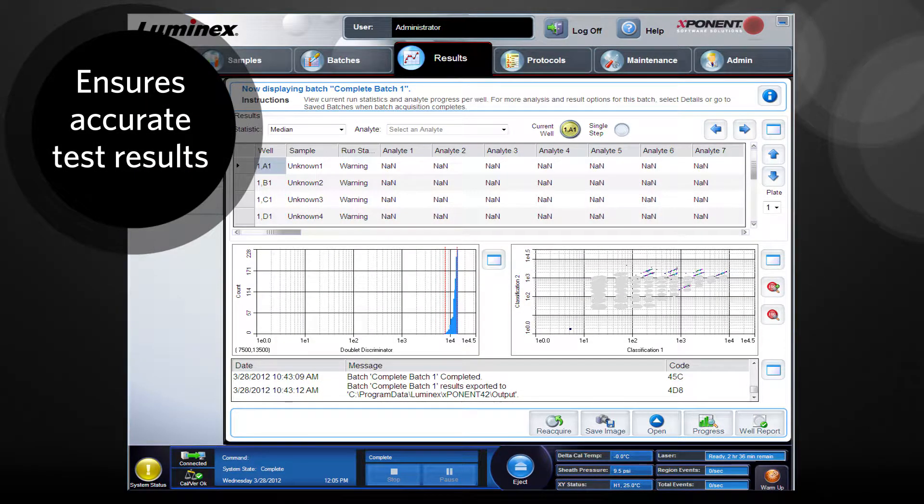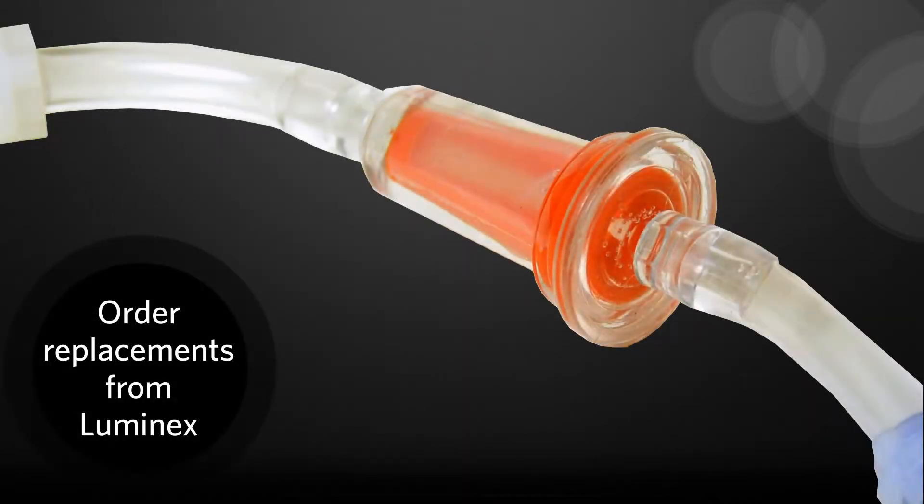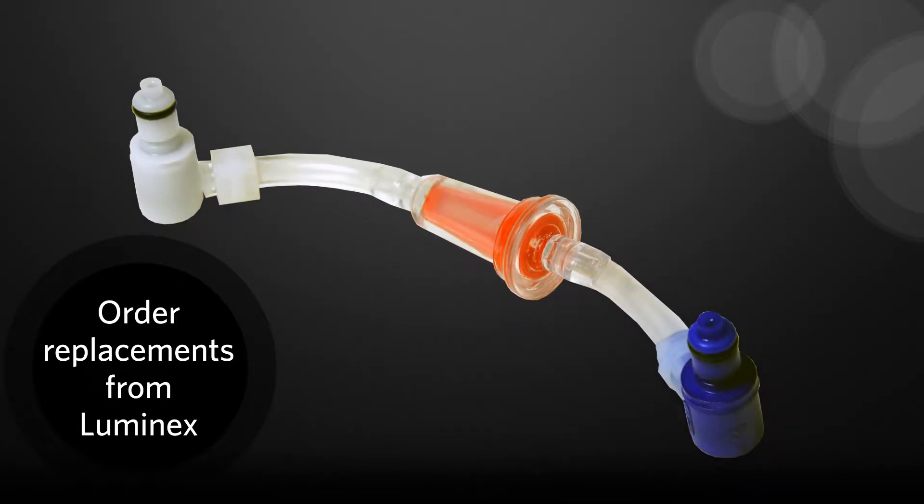Keeping the sheath fluid clean ensures accurate test results. The filter needs to be replaced annually. Replacement sheath filters can be purchased from Luminex.